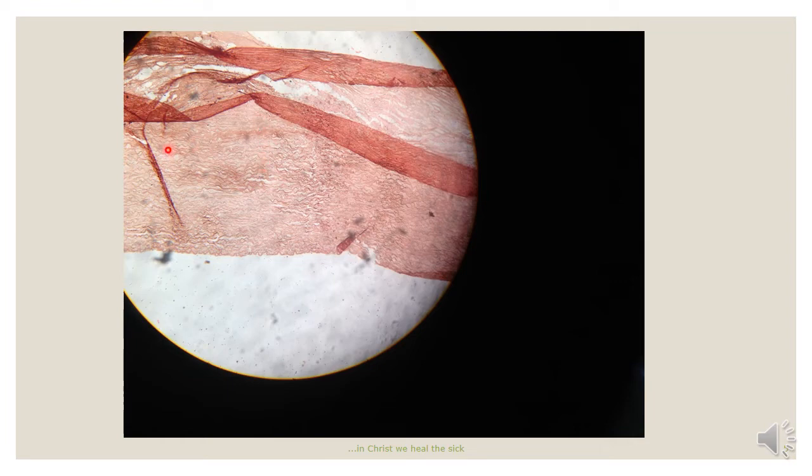We can see the wavy appearance of the fibers that make up the tunica media, which even though they are stained pink, still shows the presence of elastin fibers. So the main reason for identification of the elastic artery is the presence of elastin fibers in the tunica media.